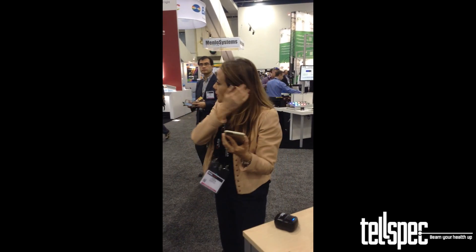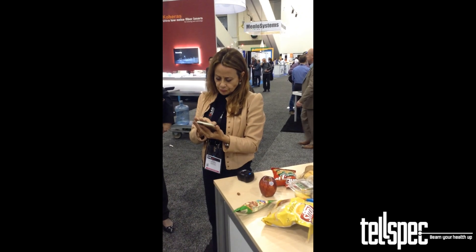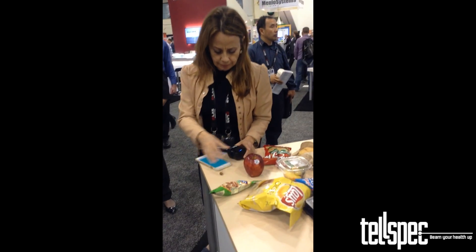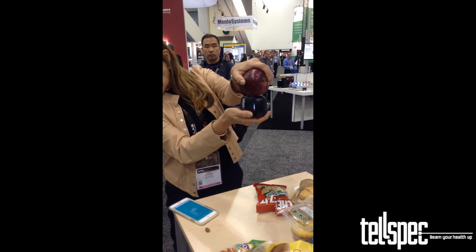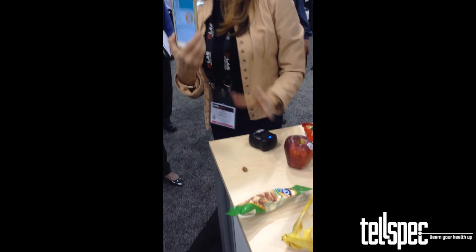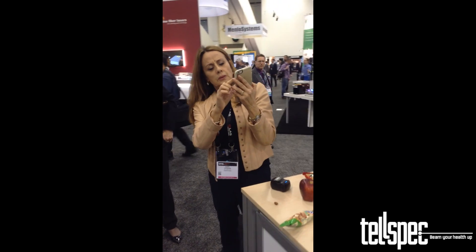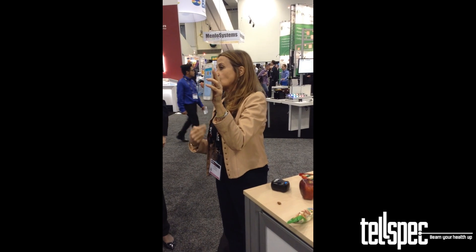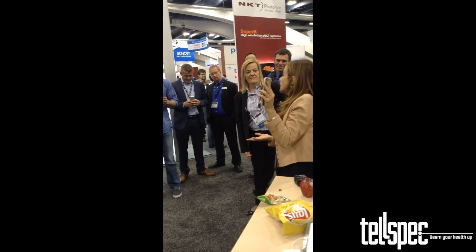Now let's do another scan — we're going to do an apple. I select scan again, and you see the light is going. I'm getting information on my app and sending it to the cloud. There's the apple. Now I'm going to compare the apple with the almond. Here's a comparison between the two snacks to see which is actually healthier. Clearly, the almond is much, much higher in calories than the apple.